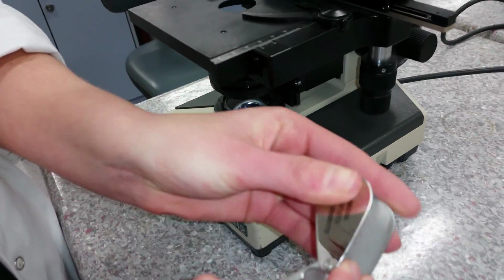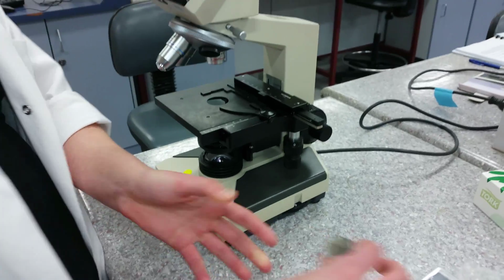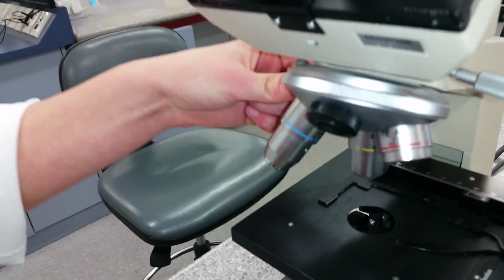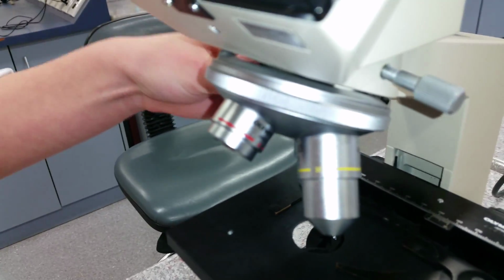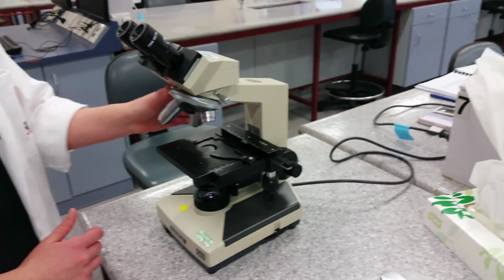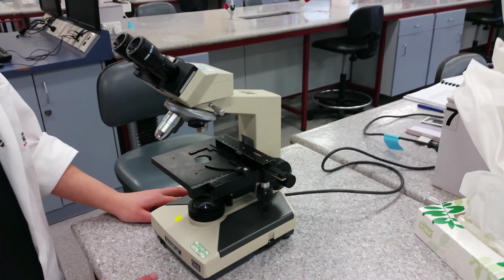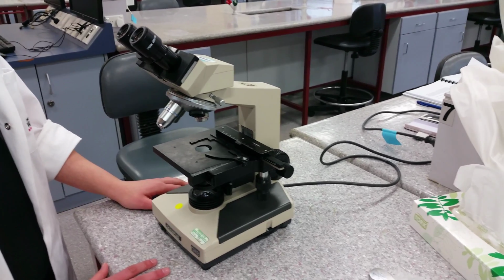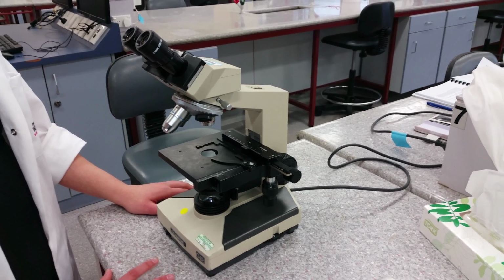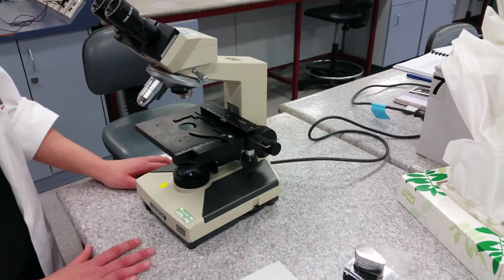of the price. What really sets this microscope apart is the choice of magnifying lenses from 4 times to 10 times to 40 times and 100 times. This means that a researcher can look at objects anywhere from 40 times to 1,000 times larger than the original size. Remember, the ocular lens is 10 times, and you multiply that by the magnification power inscribed on each objective shown here.